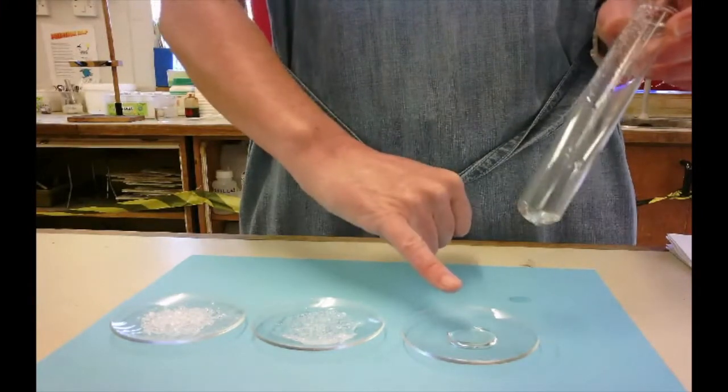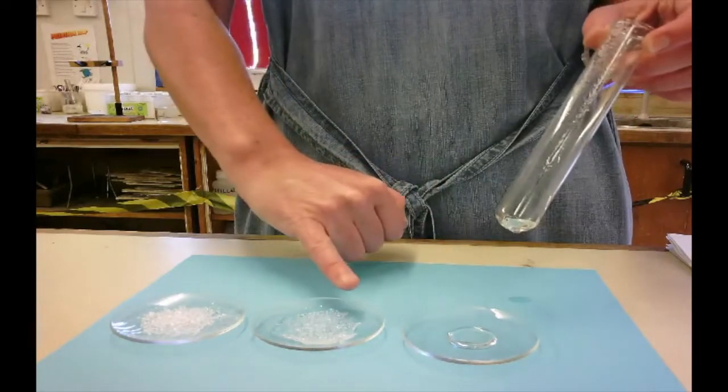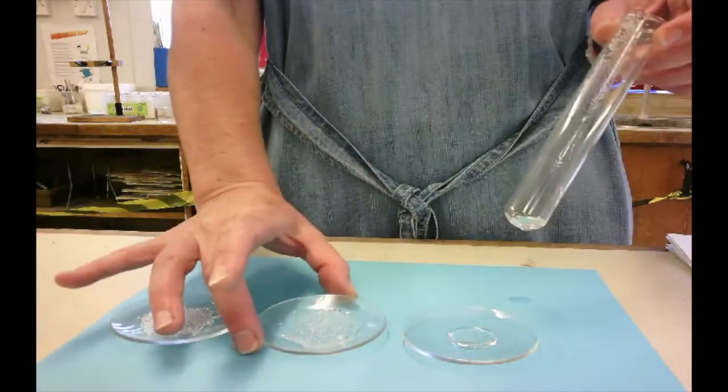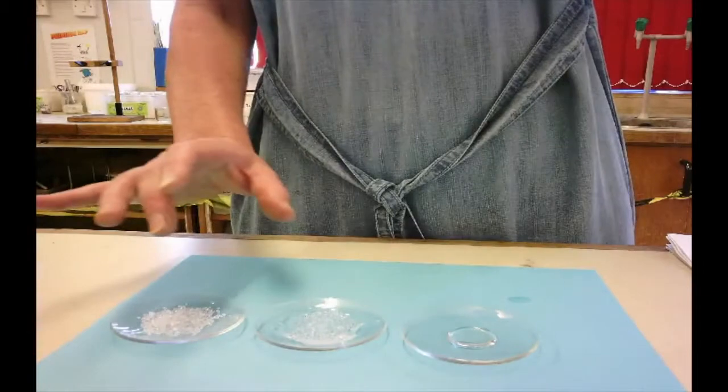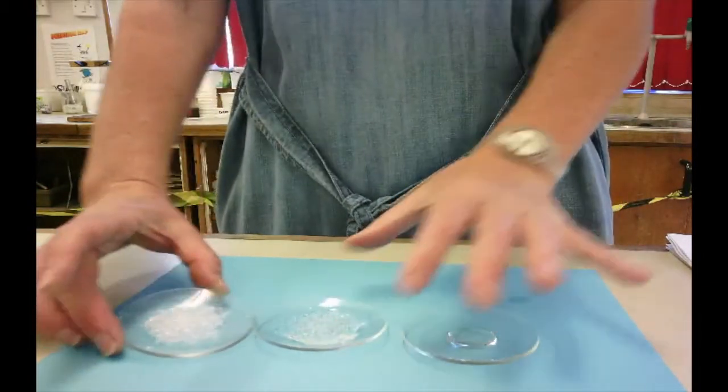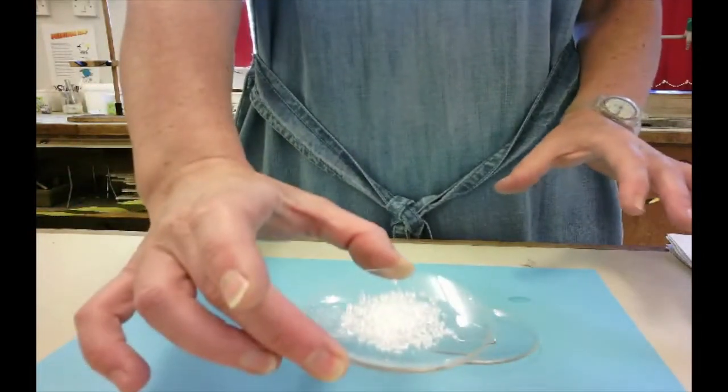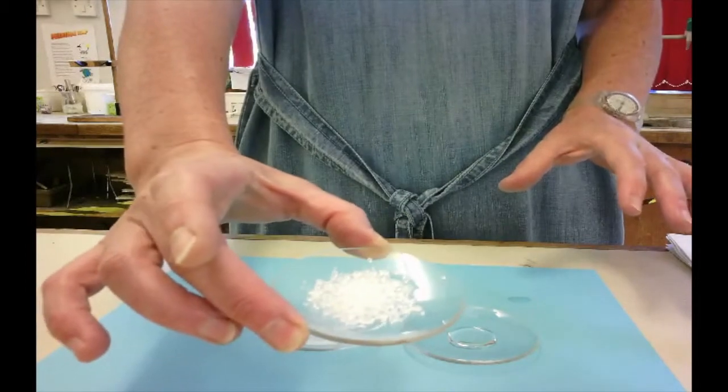You can see different stages here, and eventually you will get back to your original salol solid.